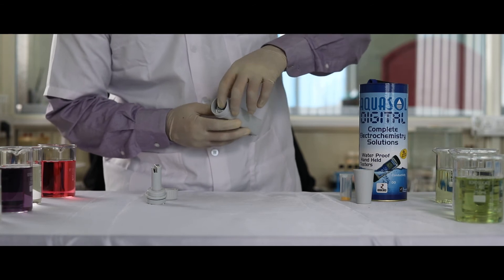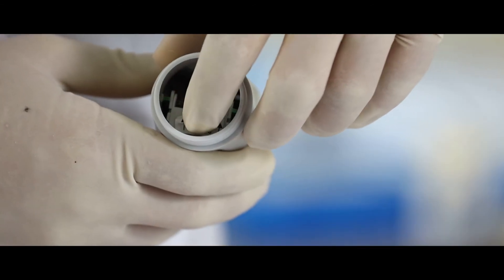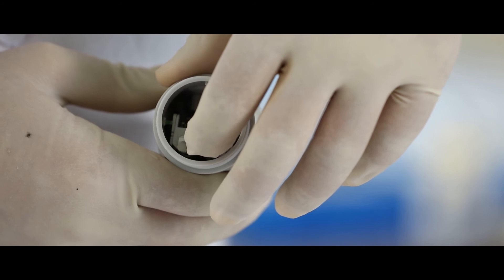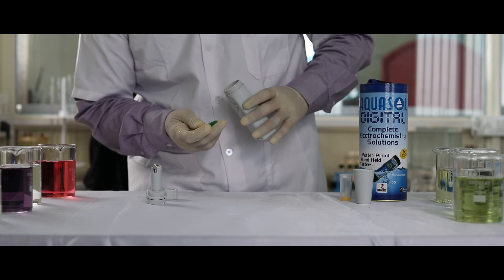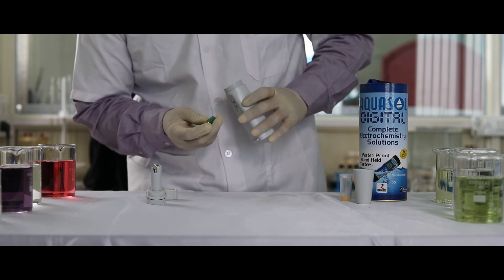Battery. To remove the batteries, remove the electrode. To open the battery pack, slide in the direction of the arrow. Please note the polarities when you replace the batteries.